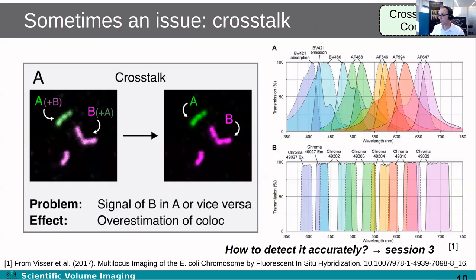Moving on, crosstalk is of course also a known phenomenon. It's not always present, but it leads to an overestimation of the amount of colocalization. If the signal from fluorophore A has a bit of a wide spectrum and therefore also appears in channel B, then the signal appears at the same place in both channels, so that appears to be colocalization, but it's really crosstalk. So if you have crosstalk, you need to correct for that, and we have a very good tool to do that. We'll go into how to detect it accurately, how to do it for just a few channels, how to do it for many channels, and how to get rid of autofluorescence. We'll cover that in session number 3.